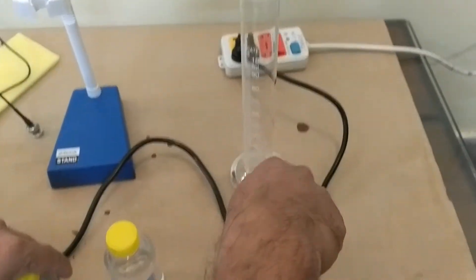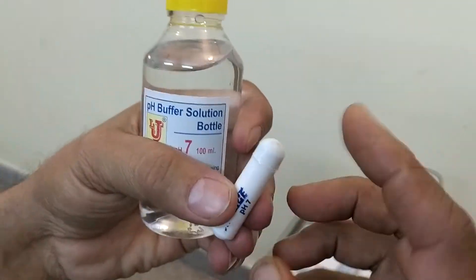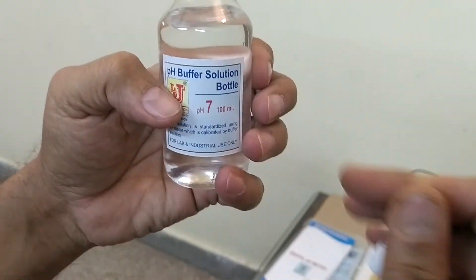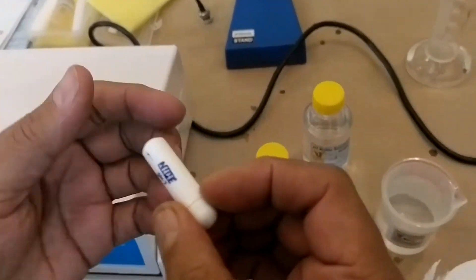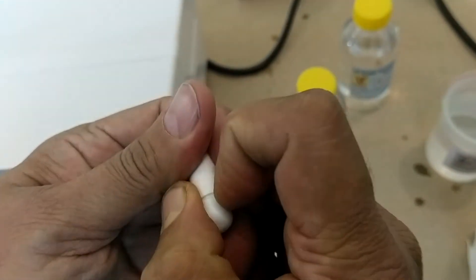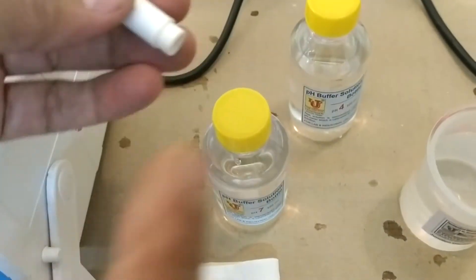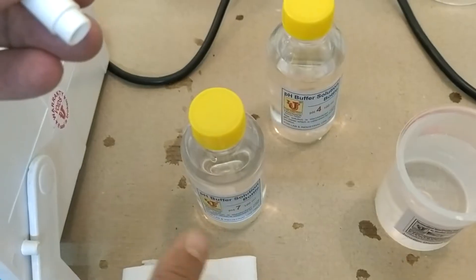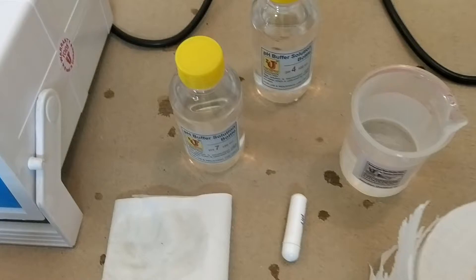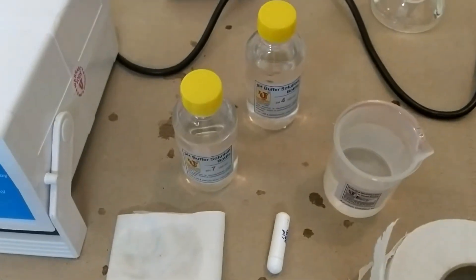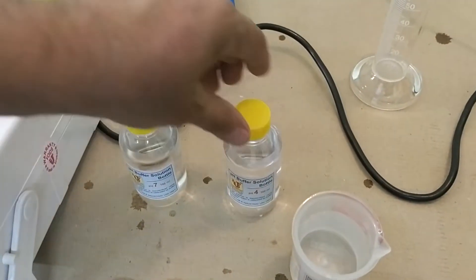You can put this capsule powder in 100 ml distilled water. You can open this and put all salt in 100 ml distilled water, and give standby for 4 hours. Your pH buffer is ready for use.